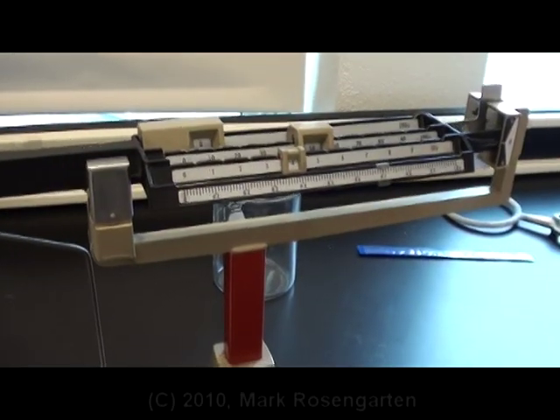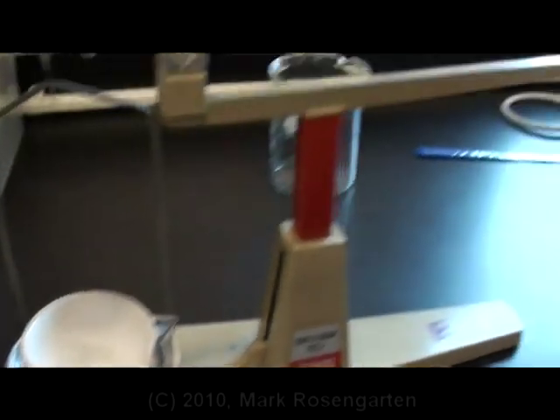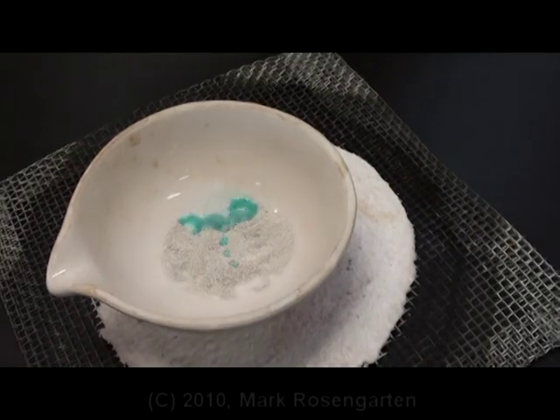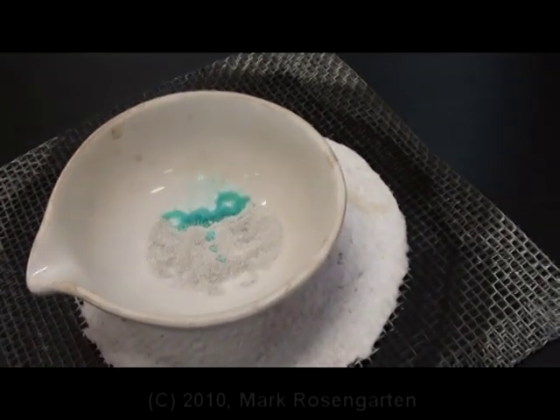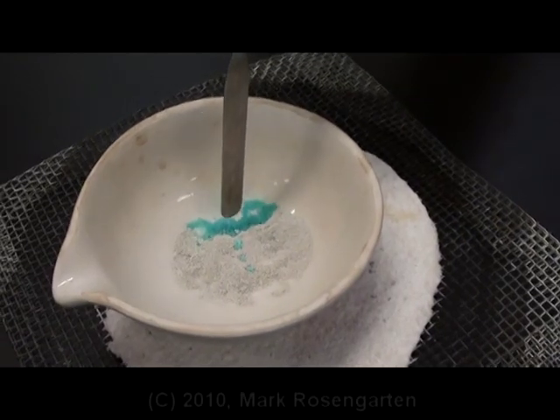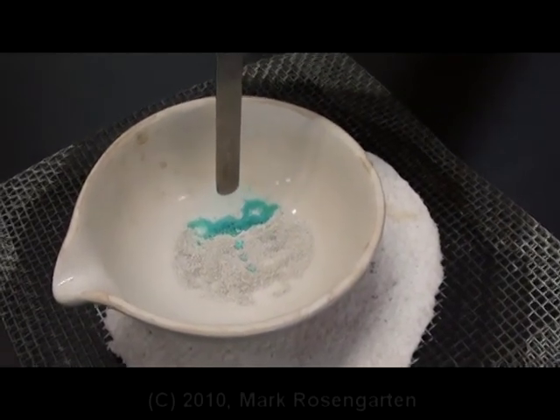This is exactly how it should look. After two minutes have passed, you place the dish back onto the balance and weigh it again. Add a drop of water. Touch your micro spatula to where you just put the water — just touch it. How does it feel? Hard. It's not wet. It's a crystal.